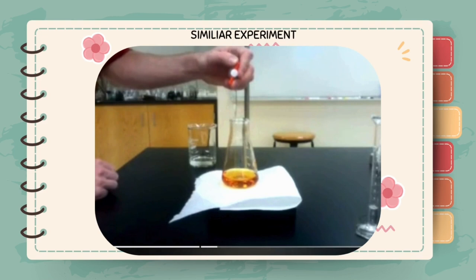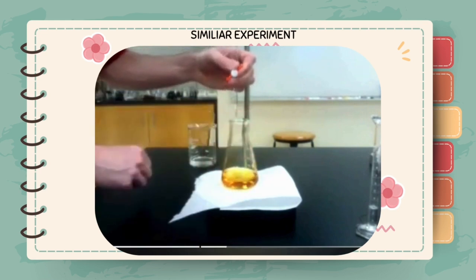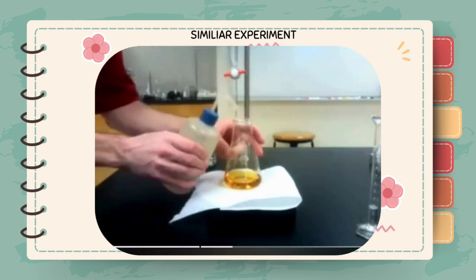For the accurate titrations that you will use for your quantification, you will want to add the starch indicator significantly later. The reason for this is that starch can permanently bind the triiodide molecule and may lead to difficulties in visualizing the endpoint.